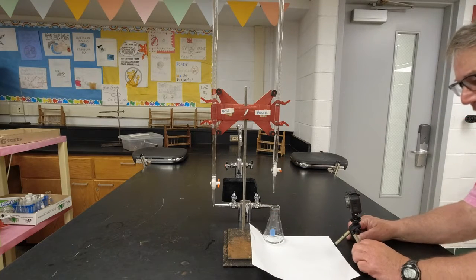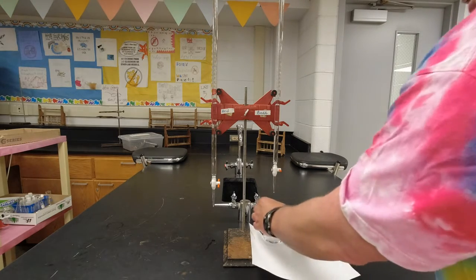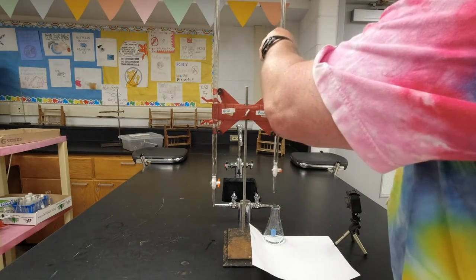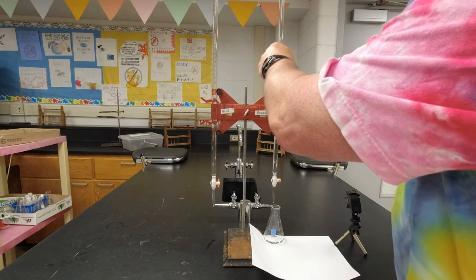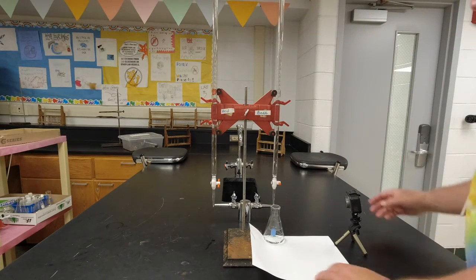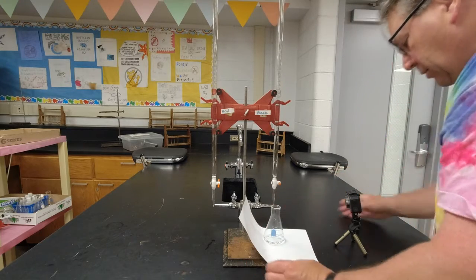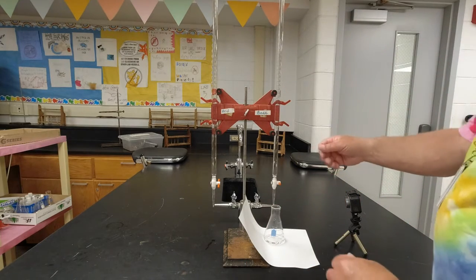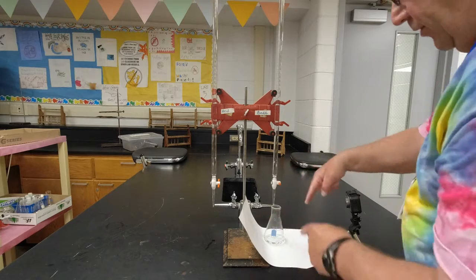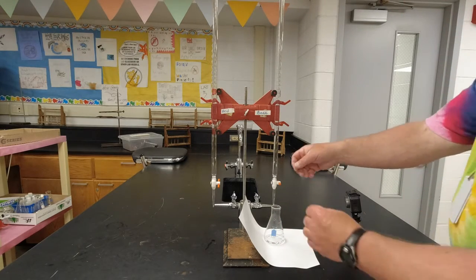And I want to make sure I get that just pink. So I'm going to swirl with one hand. I'm going to move this down just a little bit like this so it makes getting the base in there easier. I'm going to swirl with one hand, and I got this white background paper up here so that we can kind of see when it turns pink easier. All right, so here we go, and my focus is going to be all on the flask here because that's the one that's going to change color.